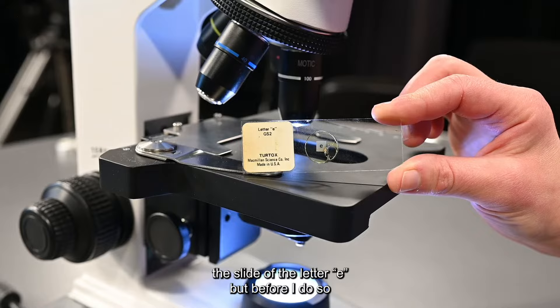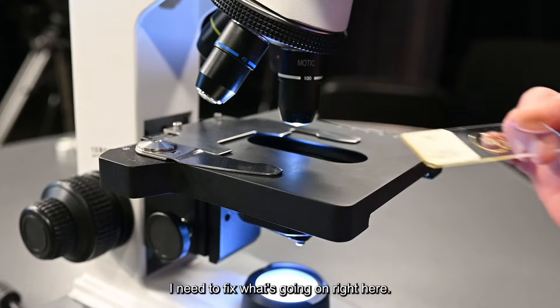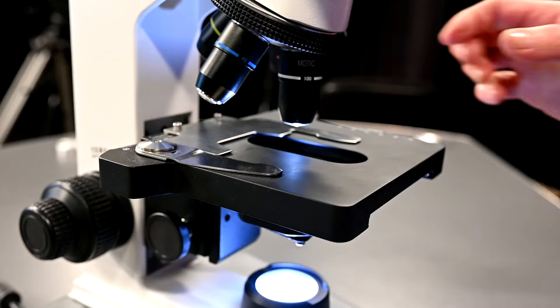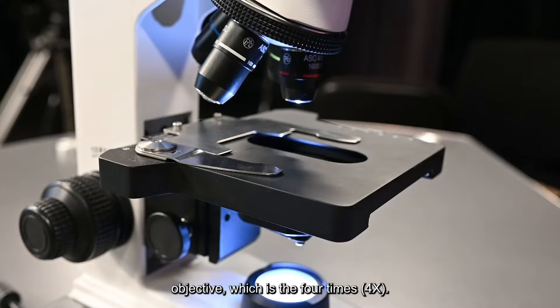I want to look at the slide of the letter E. But before I do so and even get my slide on the stage, I need to fix what's going on right here. This is a hundred times objective. We always want to start with our shortest lowest objective which is the four times.